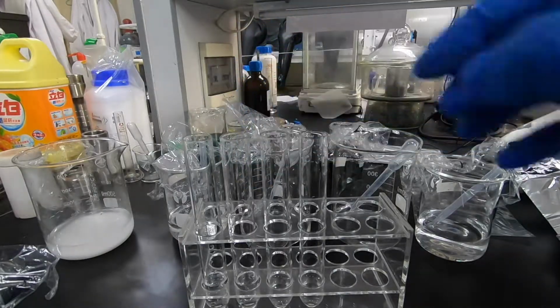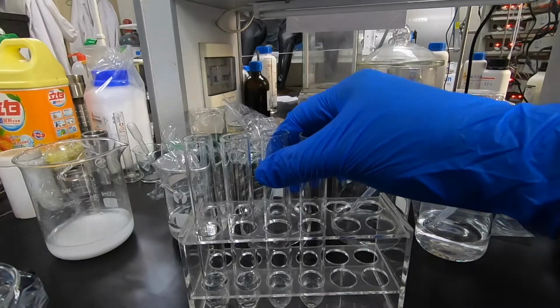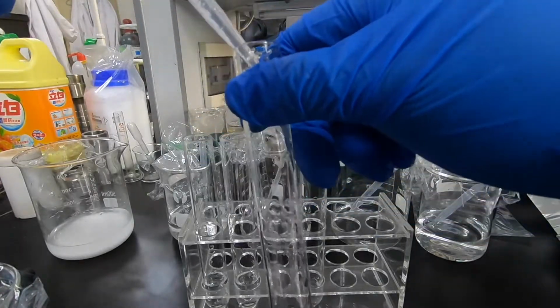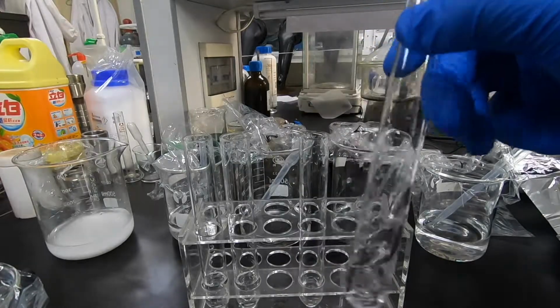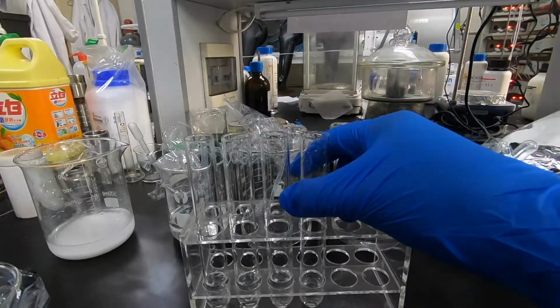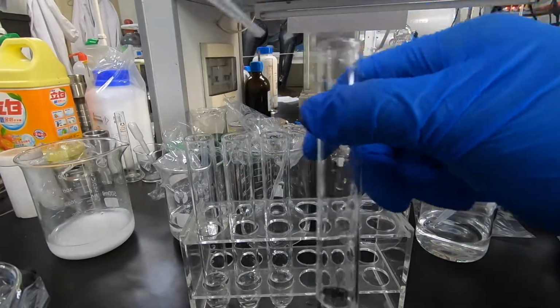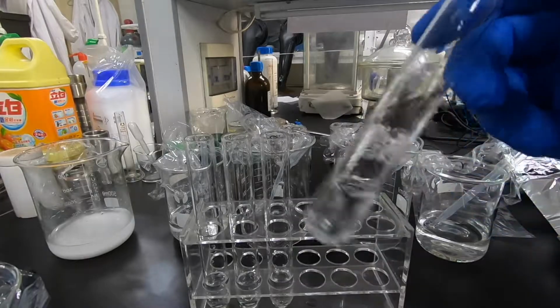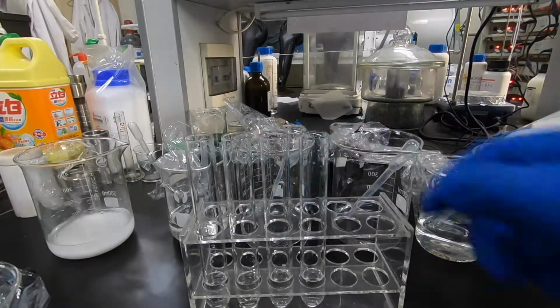So it makes it the most recognizable solution, which is sodium chloride. Sodium chloride has no reaction with all of those 4 chemicals, so the liquid remains clear and transparent.